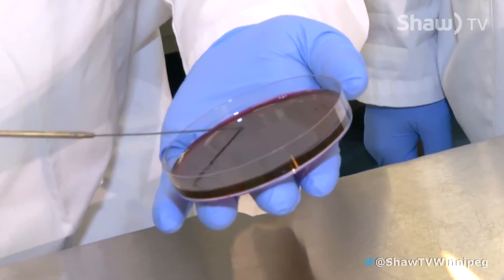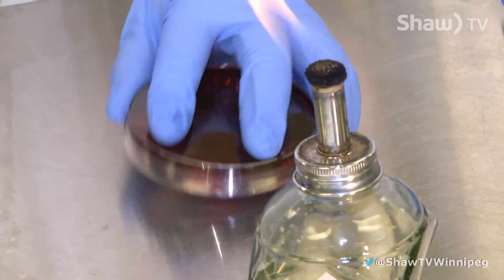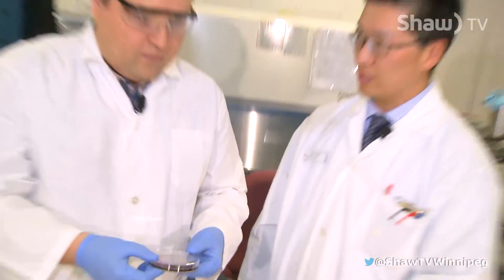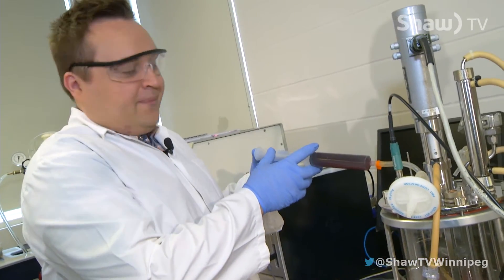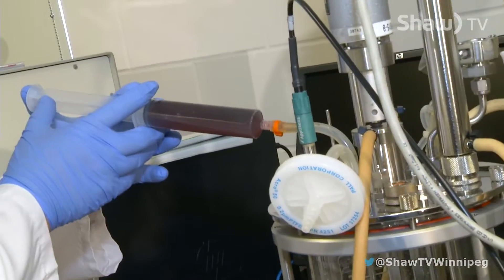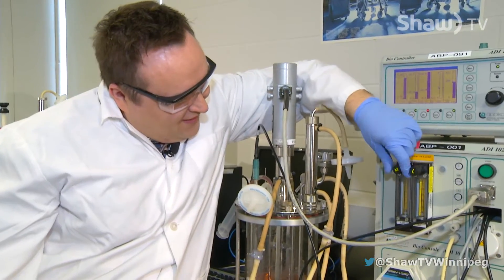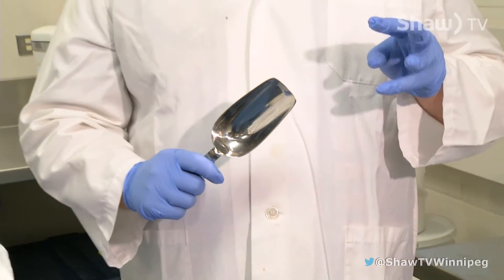Put that into the tube to pick up your culture — it sizzles. Now we can take this plate and incubate it for 24 hours at 37 degrees. All right, now we move on to the next step of pharmaceutical manufacturing.